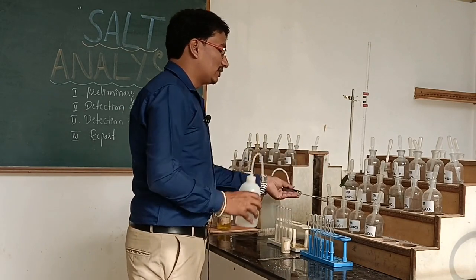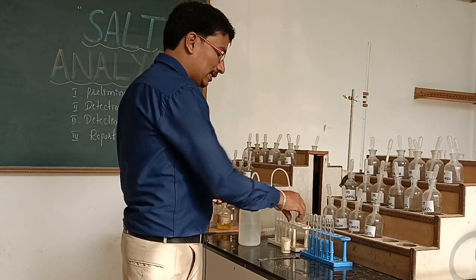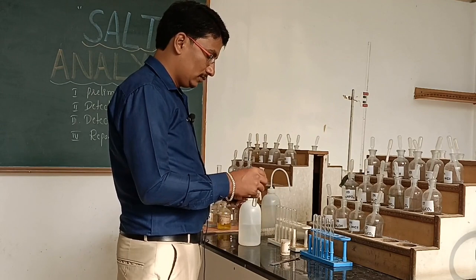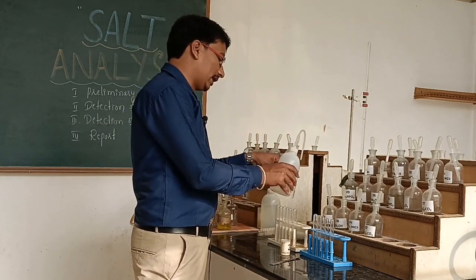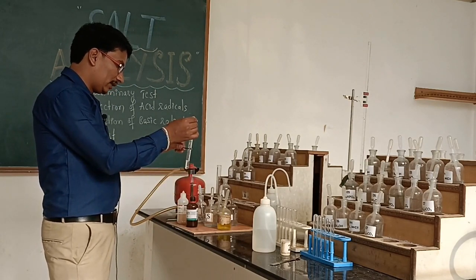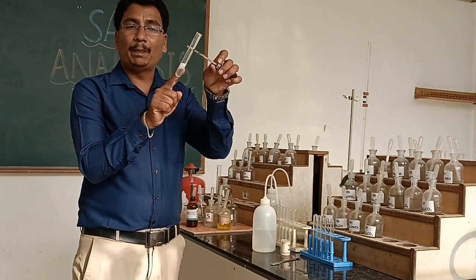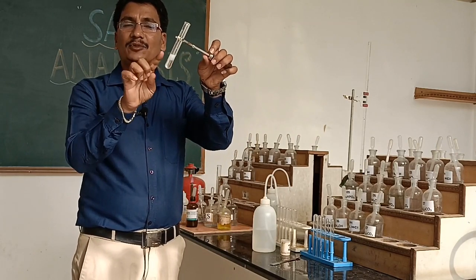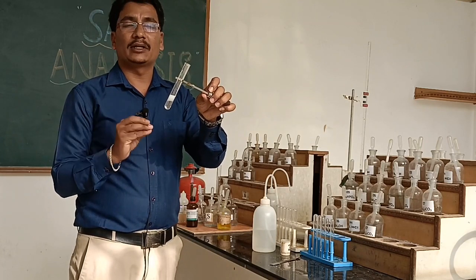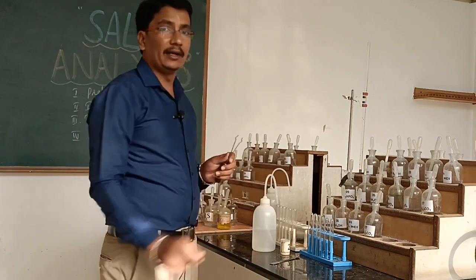For the confirmation test of bromide ion, we prepare a salt solution using water since the given salt is soluble in water. To the salt solution we add silver nitrate solution. The resulting precipitate confirms the presence of bromide ion. This is the acid radical for Salt 2.